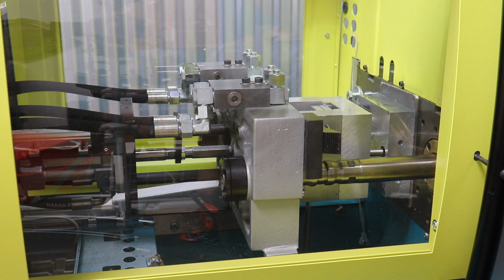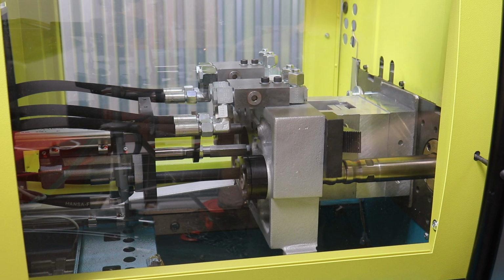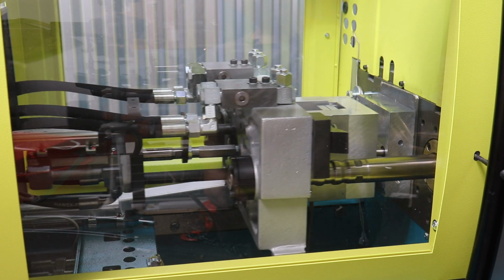You know what? I taught the mold position or the height of the mold when the mold was closed. I mean, when the mold was at room temperature, but now it's up to temperature. So let me go ahead and we'll go to teach mode. I will bring the mold in, and then I will reteach its zero position or its closed position. There, I just taught it. So now let me back out the mold, and then I'll manually, in manual mode, close the mold and see if it locks up.